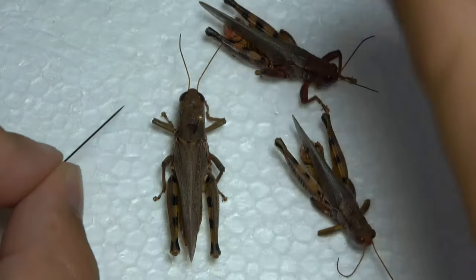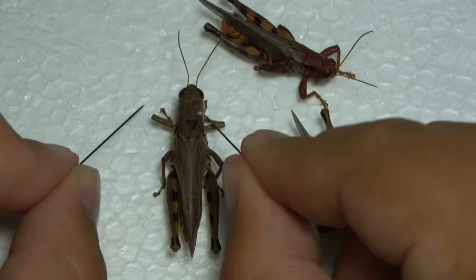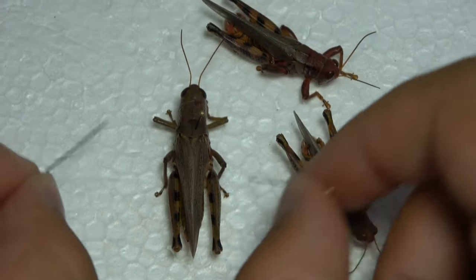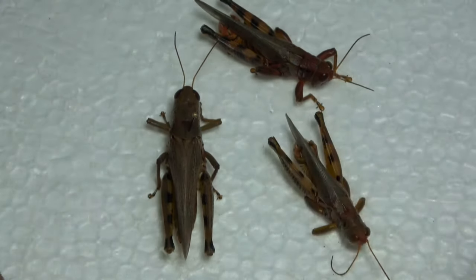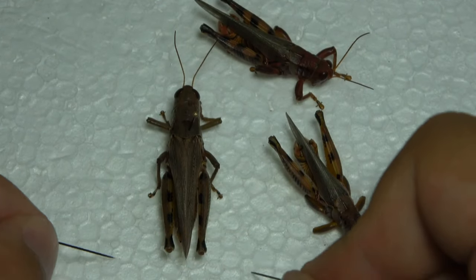I try and keep my specimens to take up as little room as possible but still look nice. So I might pull the legs out, or I might just keep them tucked up underneath. But that's basically how I pin my grasshoppers.